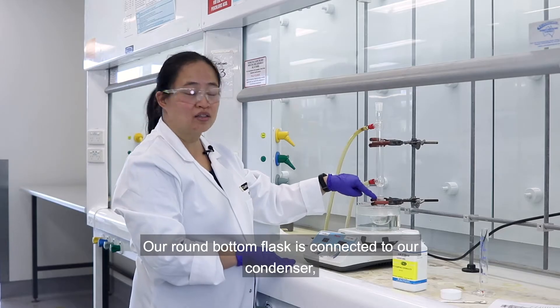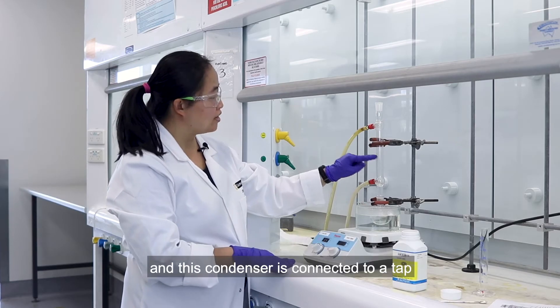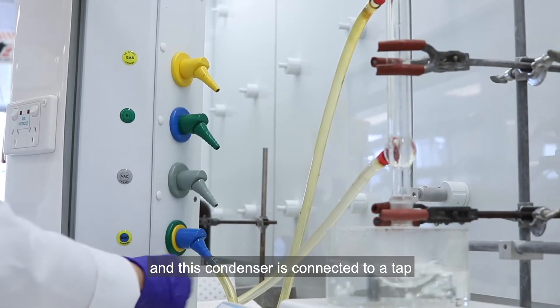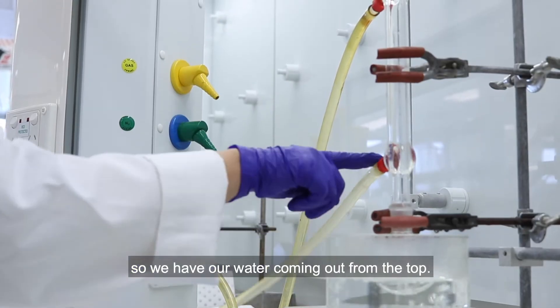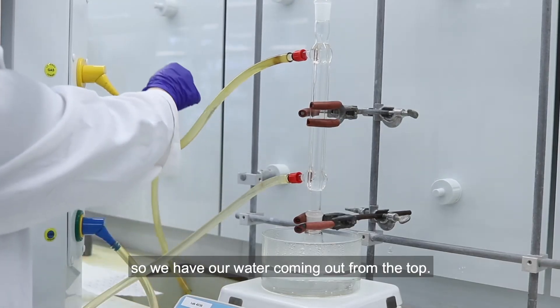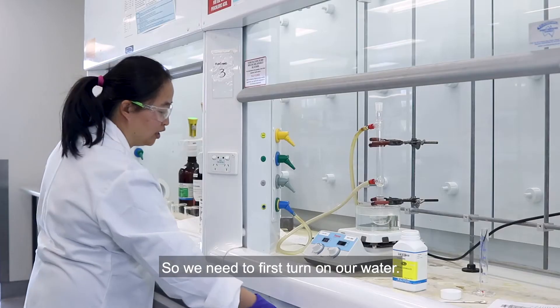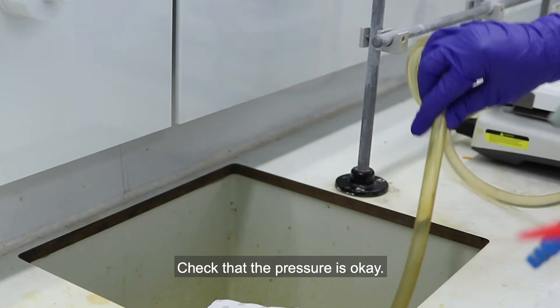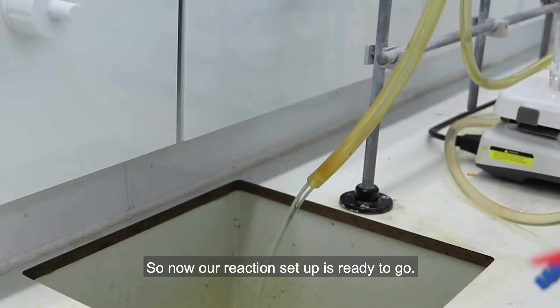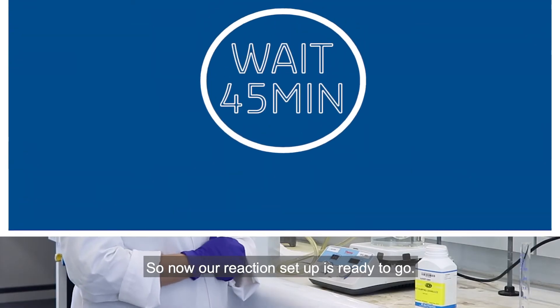Our round bottom flask is connected to our condenser, and this condenser is connected to a tap so we have water coming out from the top. We need to first turn on our water. Check that the pressure is okay. So now our reaction setup is ready to go.